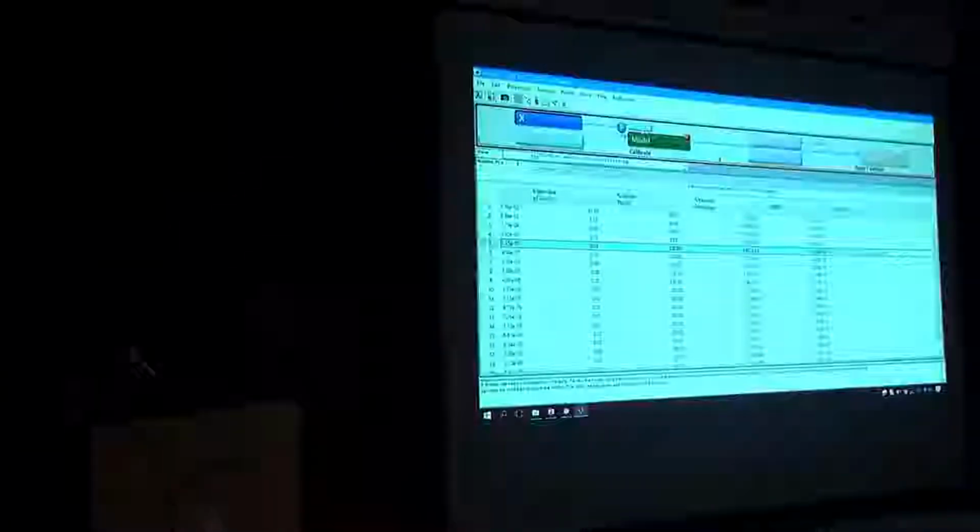So let's close this one. Let's add an orthogonalization method that is called EPO, external parameter orthogonalization. I'll have more detail on the theory side of things tomorrow. I just want to show you how it can be implemented. And then we say, what do you want to orthogonalize? We say the perturbation information. So we decide X block replicates. We say focus on the replicates. Whatever direction those replicates are following, we want to identify and subtract from the main data set.